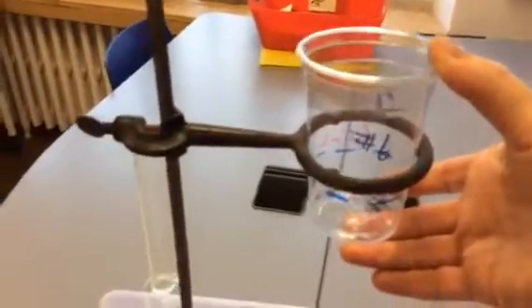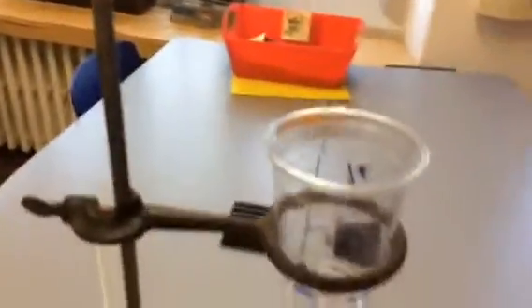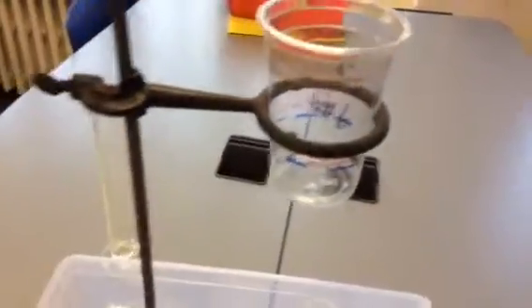Now this next setup here is going to be really important. You'll have your cup here. And now even though, say this was the 40-degree temperature, you're going to put your finger here underneath and close up that opening, right? And I have no idea how I'm going to do this here with one hand on an iPad and one hand on the oil, so I'll probably just have to do this really quick and you'll get an idea of what's going to happen here. So here's a key part of the procedure. So I'm going to have to step back here to show you.